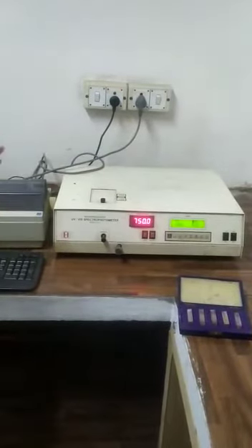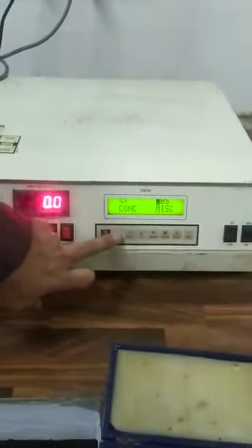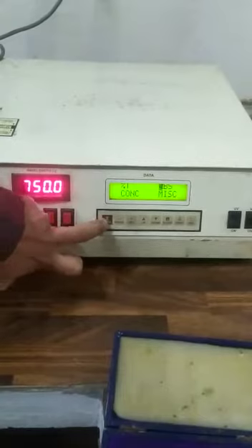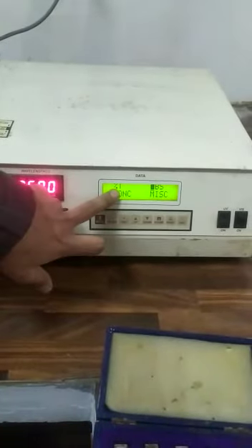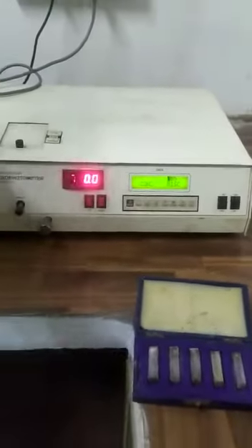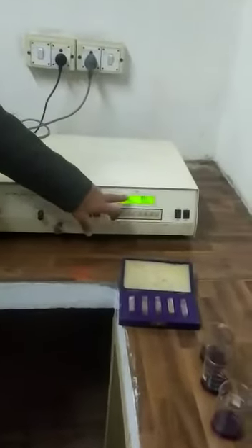Now this is very simple. This is blinking at absorbance — if you enter that, it will give you absorbance. By changing the mode it moves to concentration, and then to miscellaneous when you perform that. T is transmittance, ABS is absorbance, CONC is concentration, and miscellaneous is your printer. In most experiments they ask about concentration or transmittance. My advice is that when you perform the experiment, you should record all three parameters: transmittance, absorbance, and concentration.